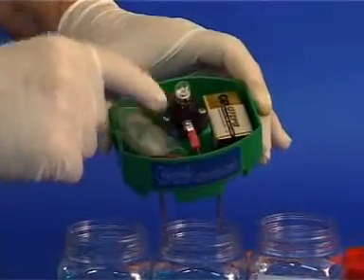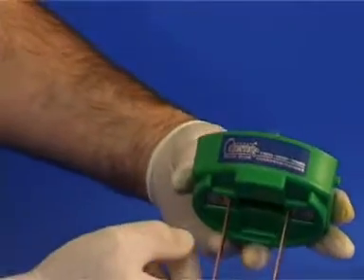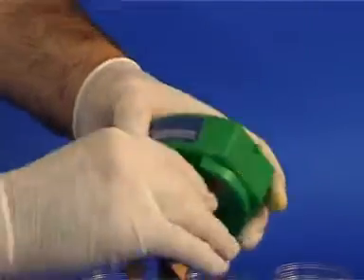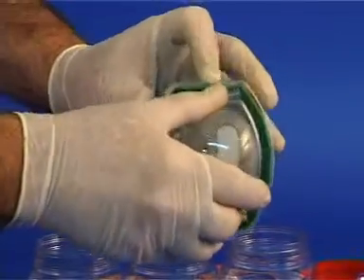There are two wires extending towards two electrodes. The wires are connected to the two electrodes in series. Use sandpaper to polish the electrodes. Now, replace the cover.